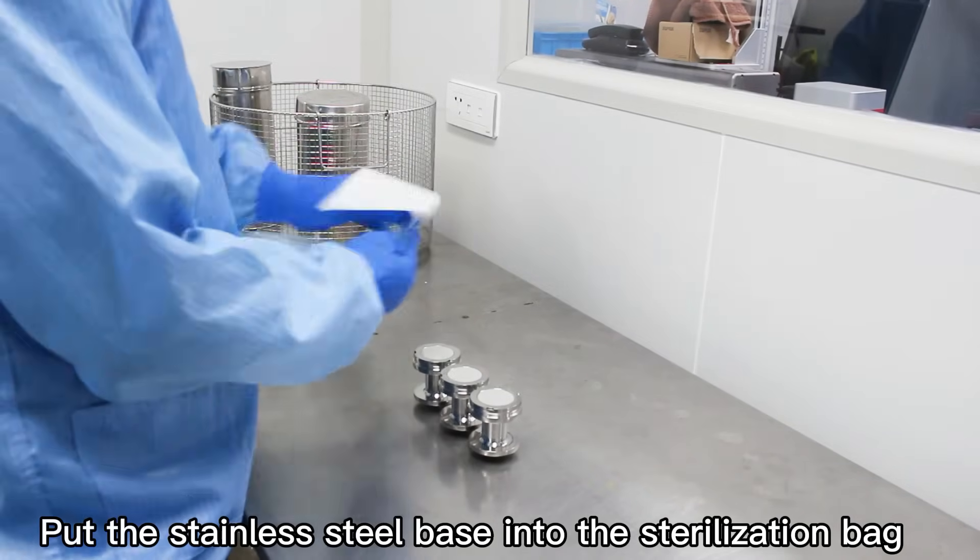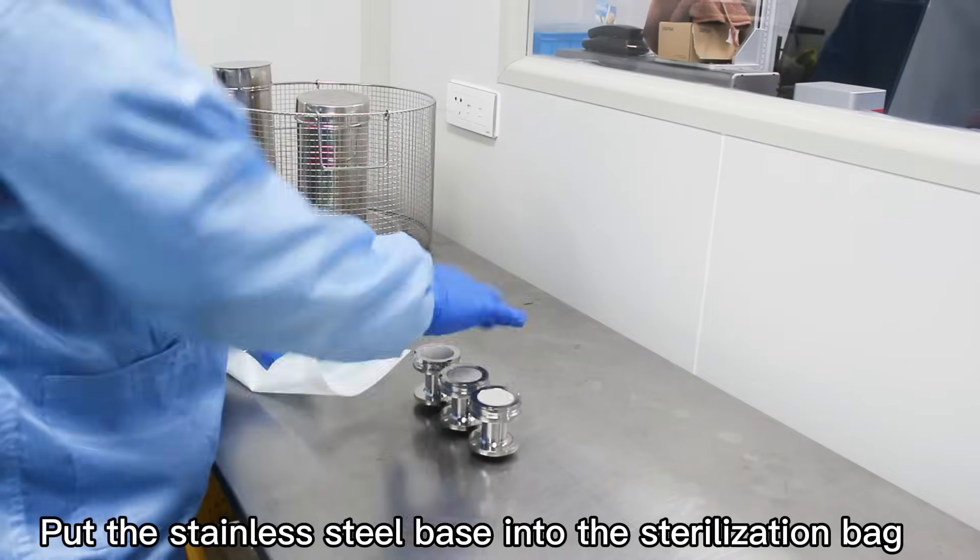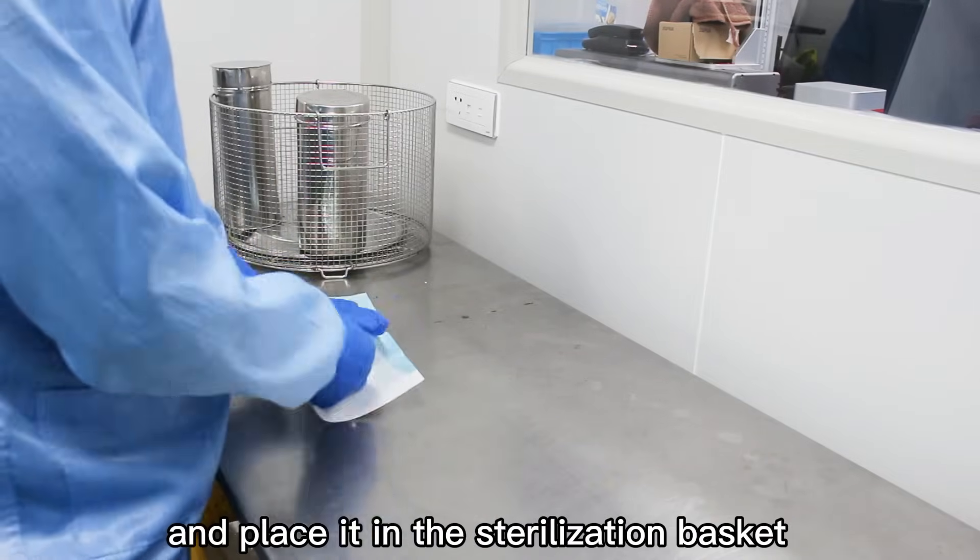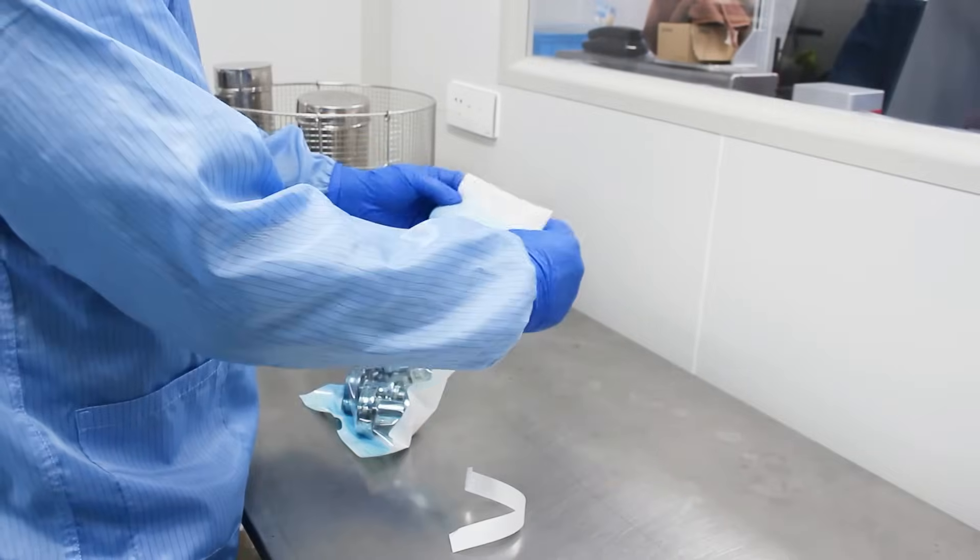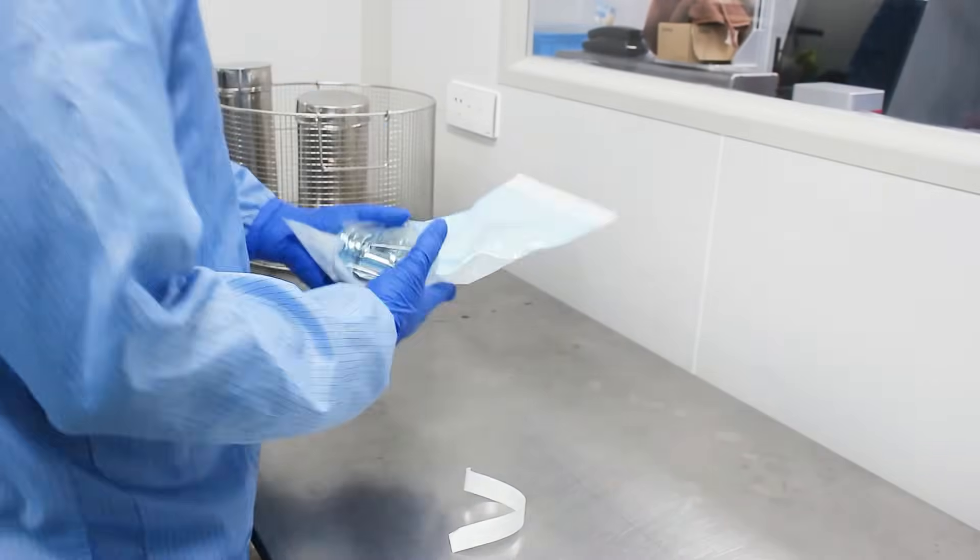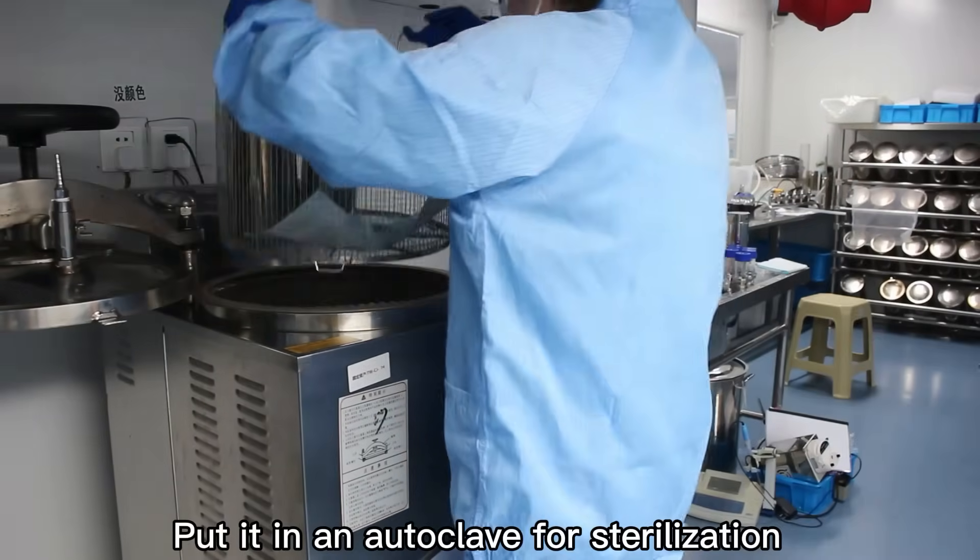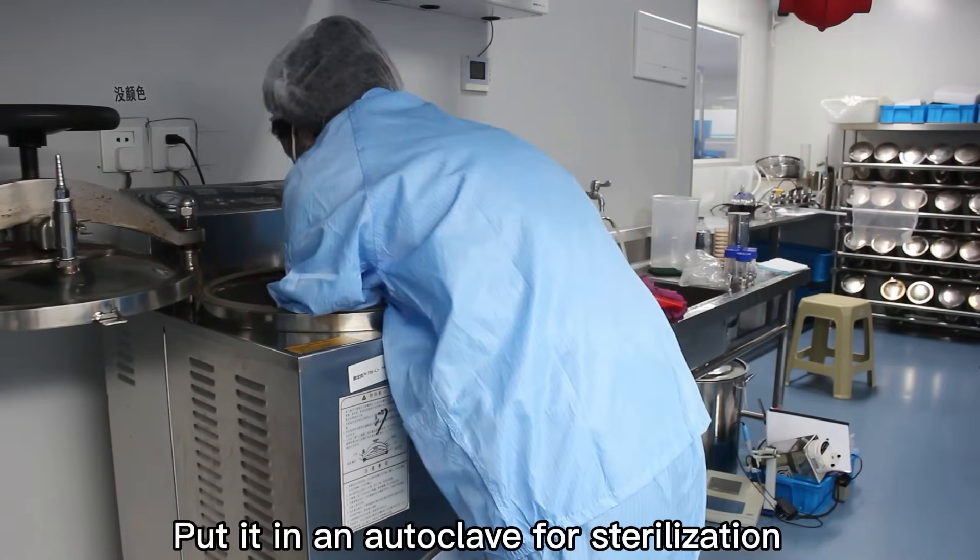Put the stainless steel base into the sterilization bag and place it in the sterilization basket. Put it in our autoclave for sterilization.